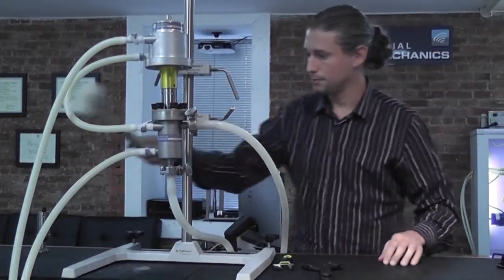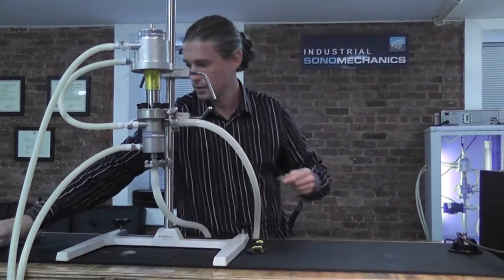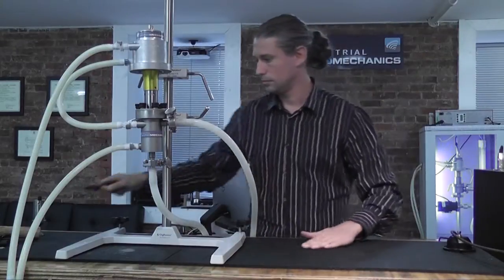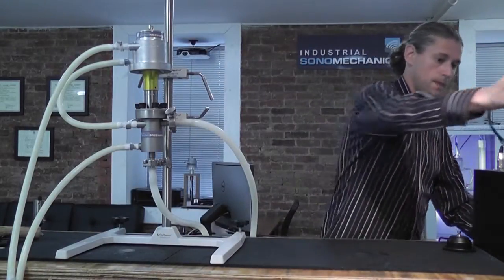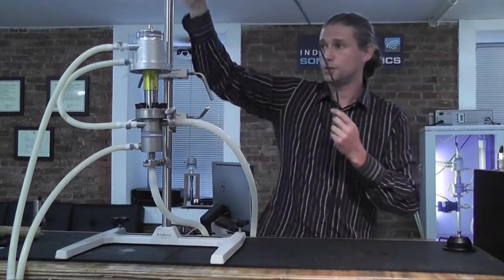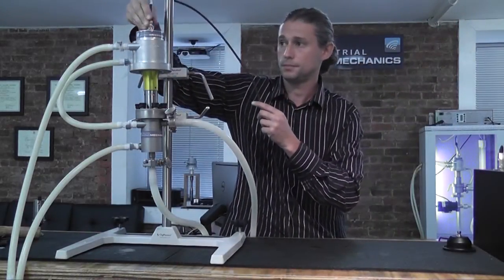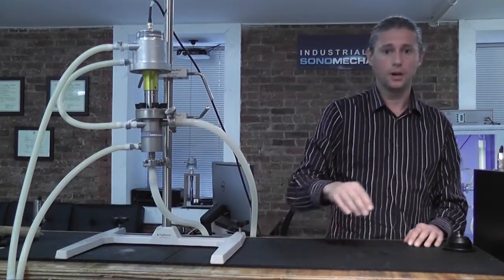Get rid of the tools, connect the ultrasound cable to the top of the transducer and turn the generator on.